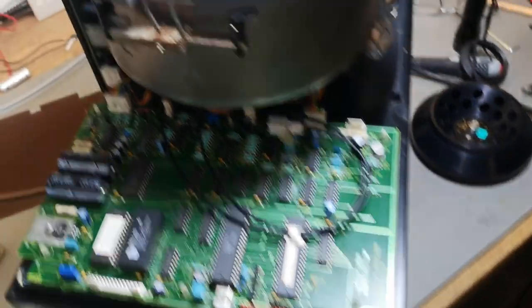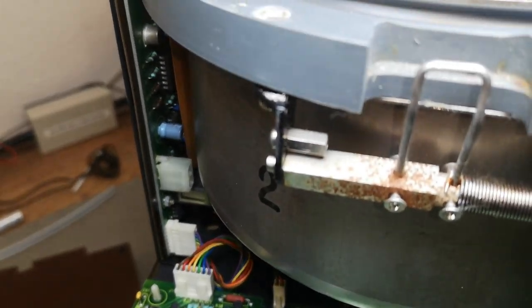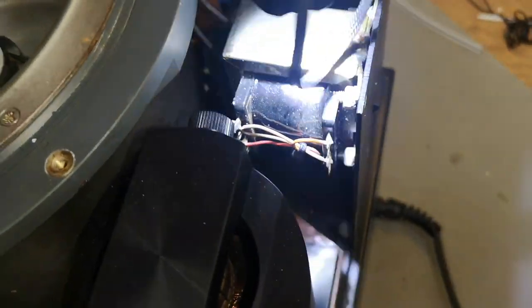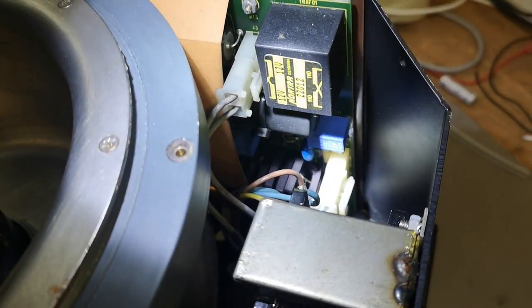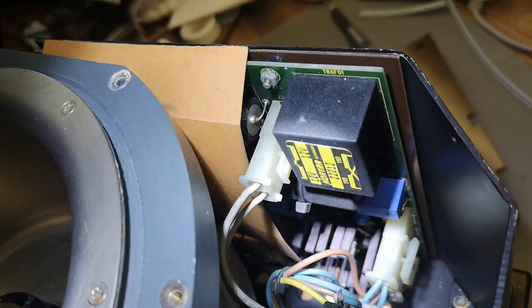Here is the motor power board — just a motor speed controller board with some coils, relays and stuff like that. There's also a main transformer power supply, a little tiny transformer, a little regulator, and that's kind of all there is to it.